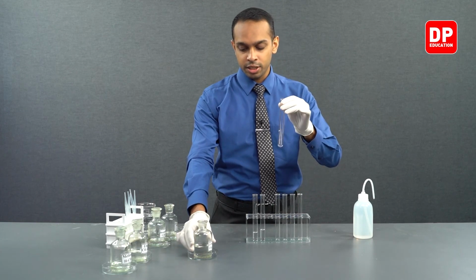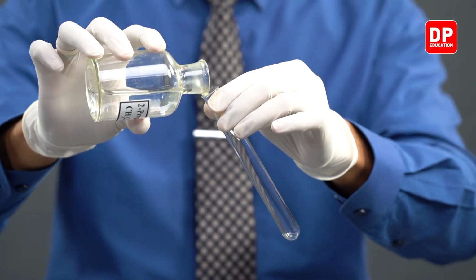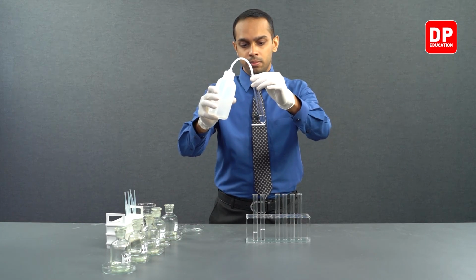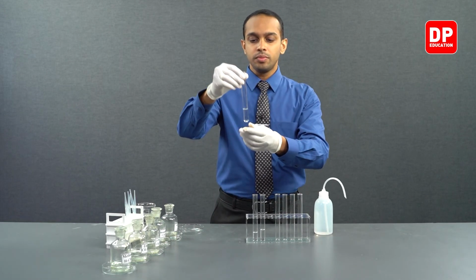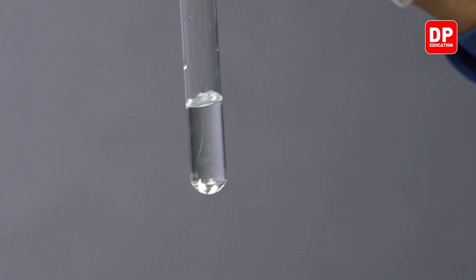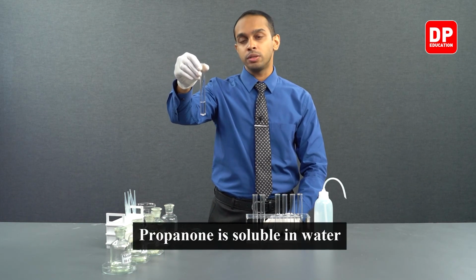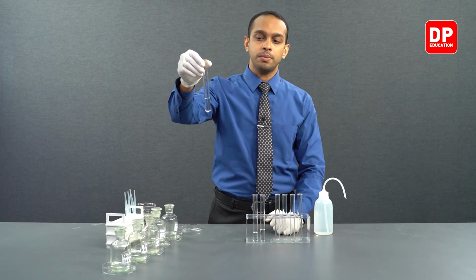We'll take a test tube and transfer a small amount of 2-propanone into it and add a small amount of water with the help of our wash bottle. Here you can see on addition of water into 2-propanone, we did not form two separate layers, indicating that 2-propanone, or acetone, is soluble in water, or miscible in water.